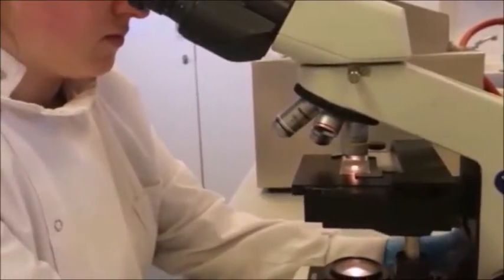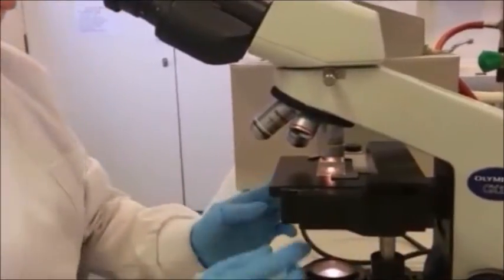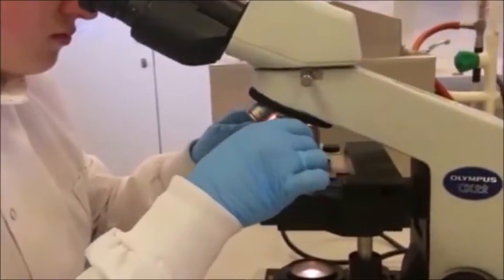To change to higher magnifications use the fine focus knob until the specimen is clearly in focus, then rotate the nose piece to increase the magnification.